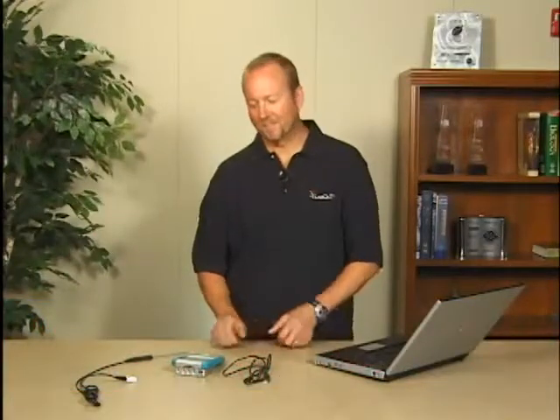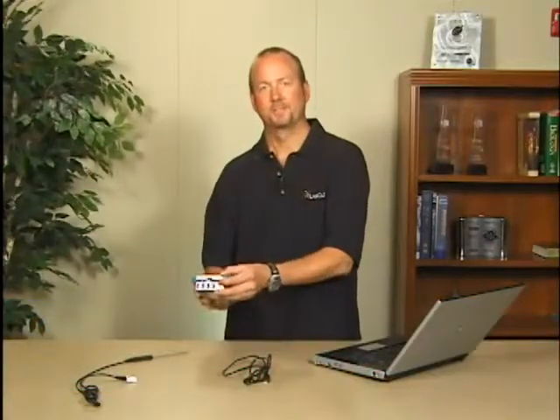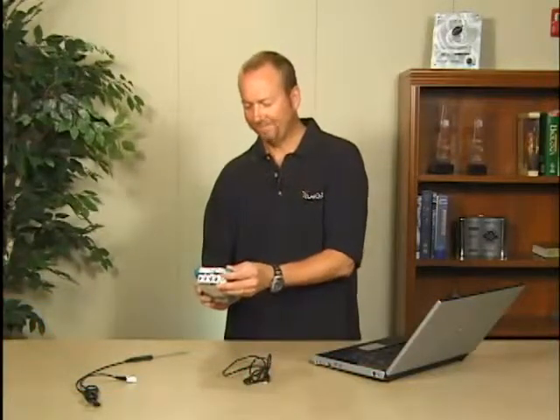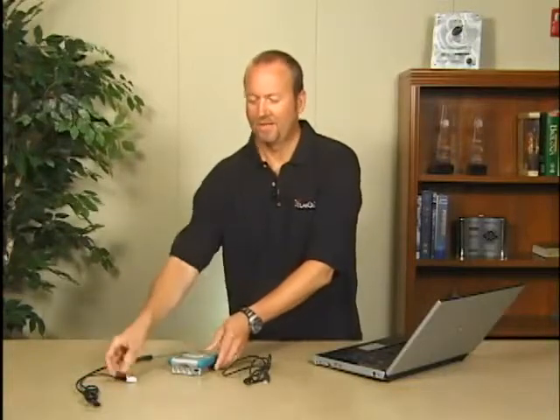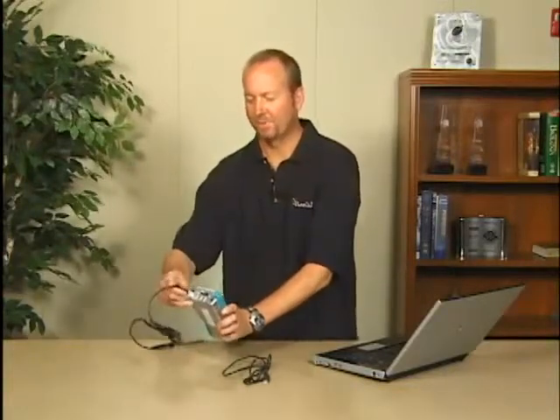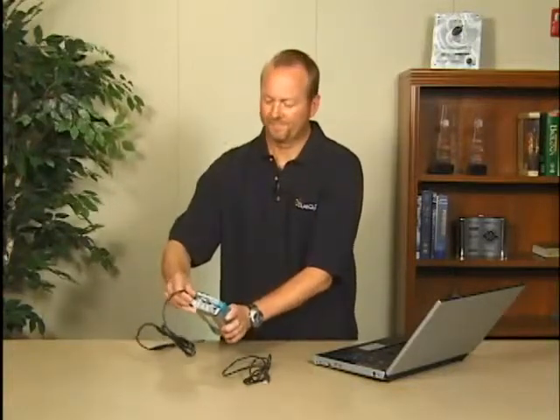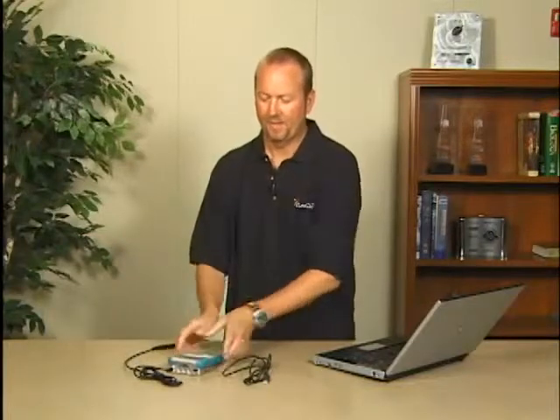I'd like to show you how to connect LabQuest to a computer to use for real-time data collection. It's very easy. First, you turn on the LabQuest by pressing the on button. Then we'll connect our sensor, a temperature probe.